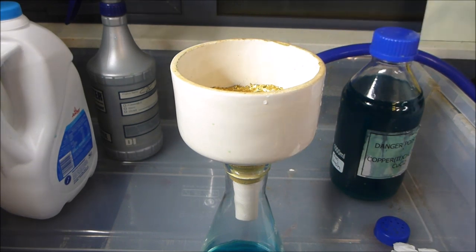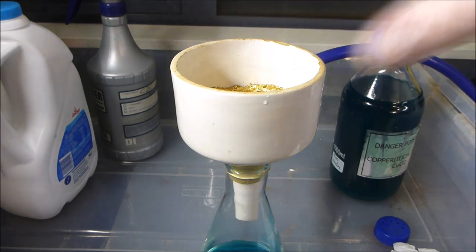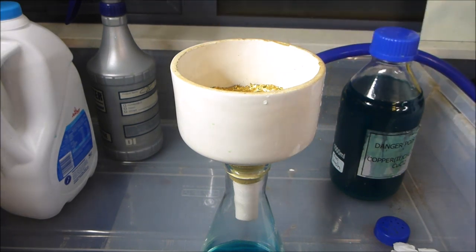I better patent this quickly. And it's an absolute winner. Like, I wish I'd thought about this years ago, because it would have saved me days and days of filtering difficult solutions. So just for those of you who have hung around up to now, I'll quickly go through a few little tips and tricks for doing the AP process, especially the washing part, just to show you guys how I end up with as little waste as possible and do things as quickly as possible.